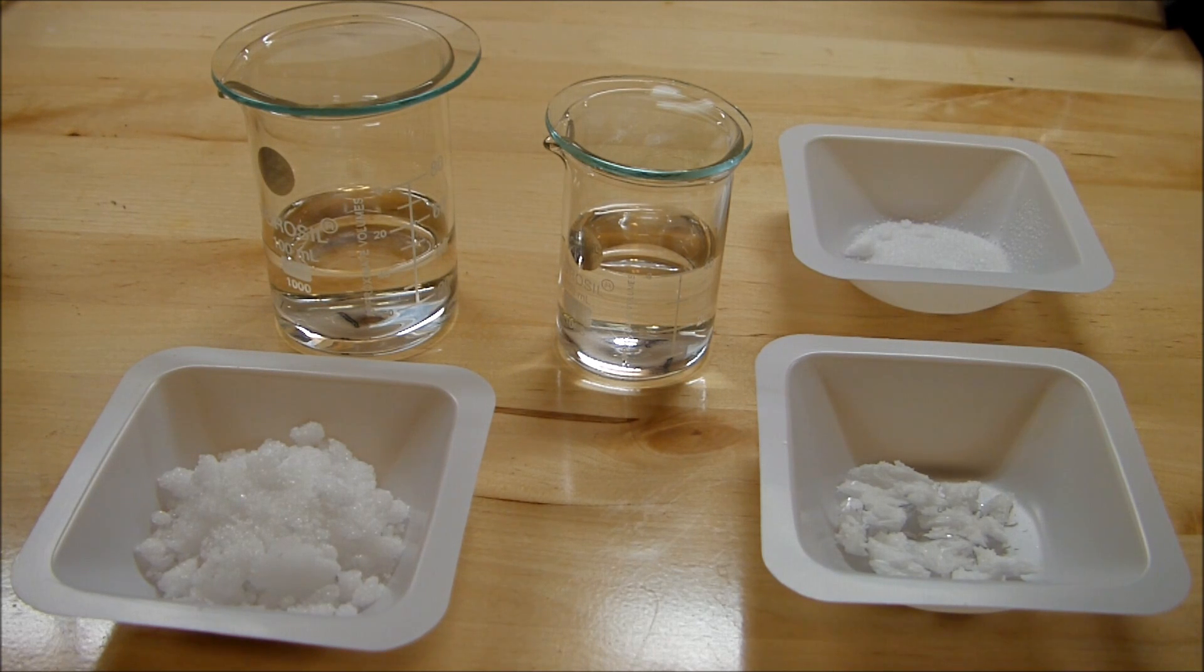Hello YouTube. Today I'm going to be making a very interesting chemistry device called a storm glass. It's used to predict the weather based on differences in solubility that are caused by differences in temperature and pressure.